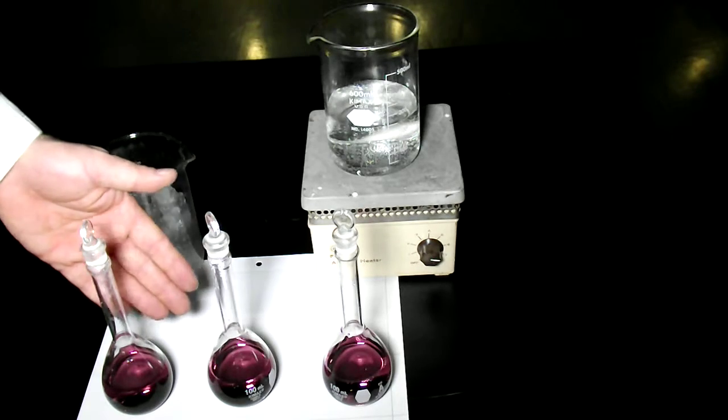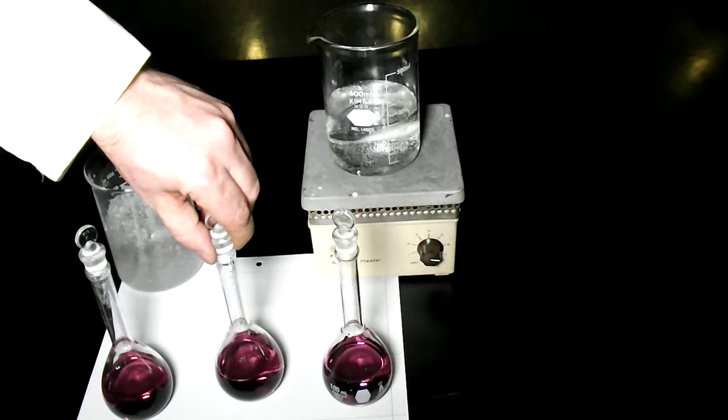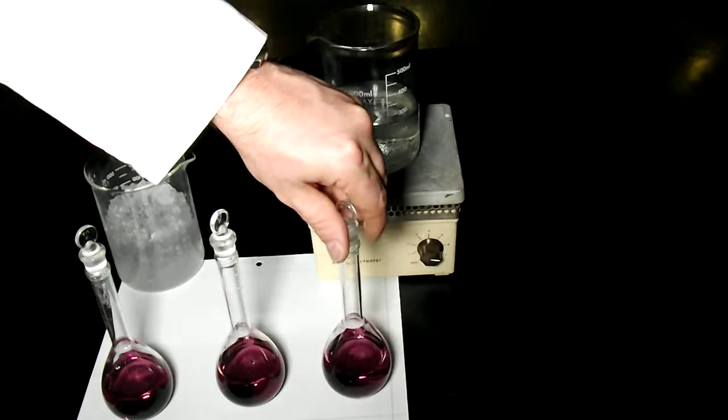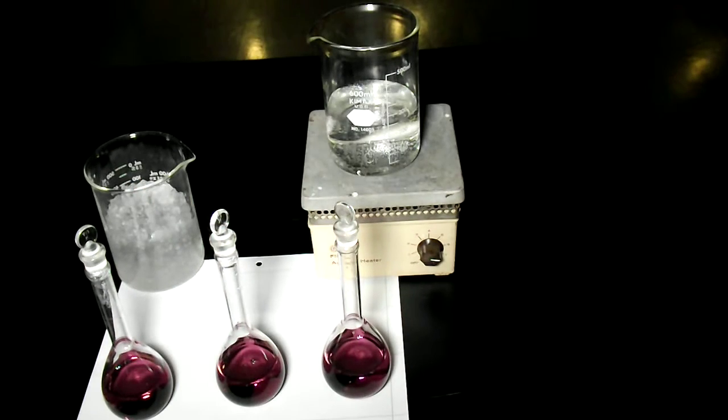containers here right now, and they all contain the exact same solution of cobalt chloride and water. You'll notice that they're the same color.